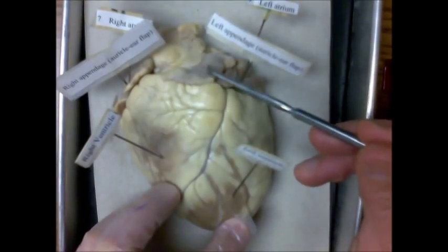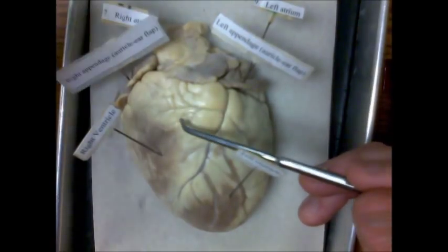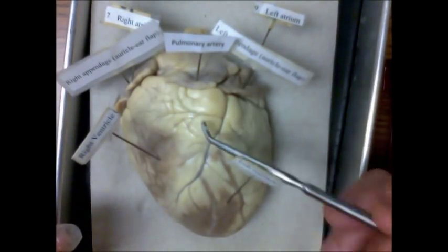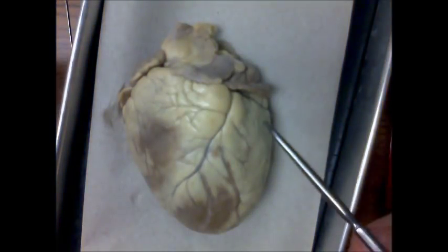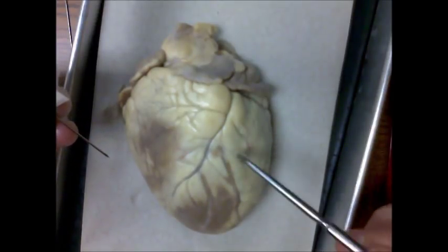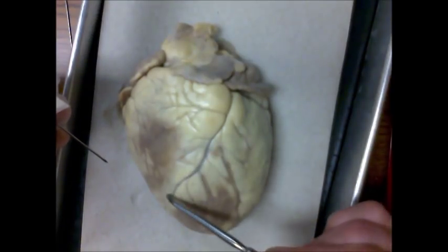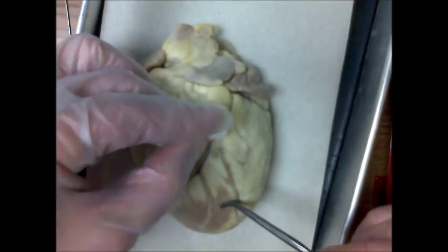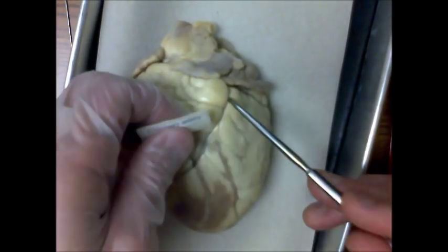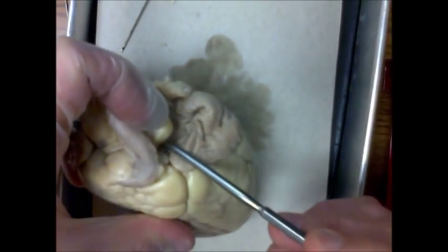Another major landmark on the anterior surface is the pulmonary artery, which is the most anterior blood vessel that can be seen. Another major structure found on the surface of the heart are the coronary arteries that feed the heart muscle or myocardium itself. It is often these blood vessels that become blocked and result in a heart attack. The coronary arteries actually branch off the base of the aorta, which cannot be seen from this view.